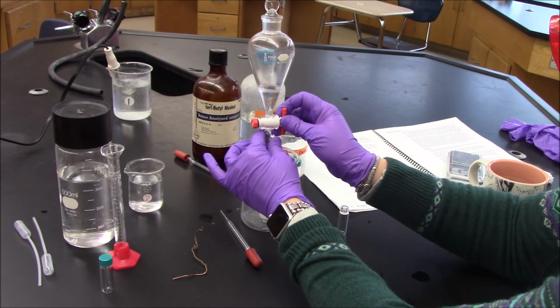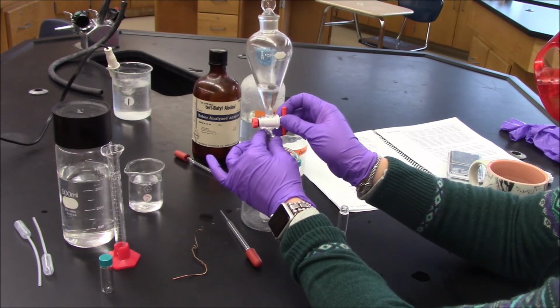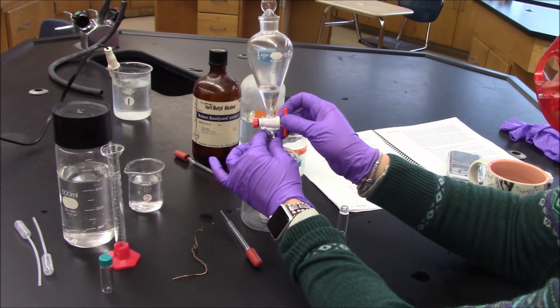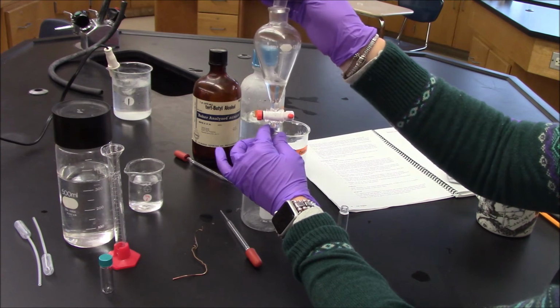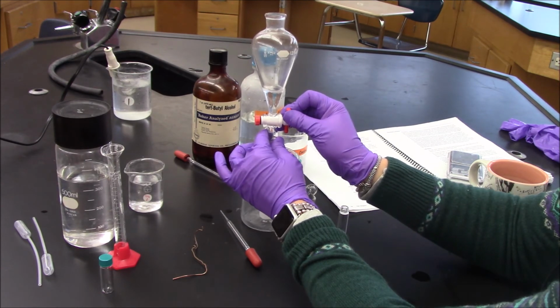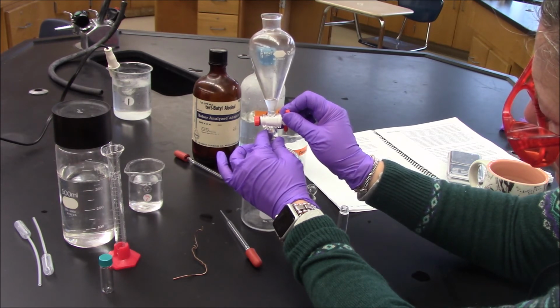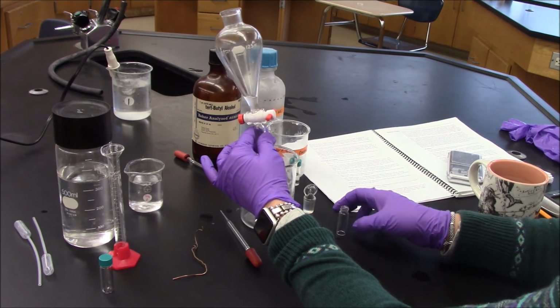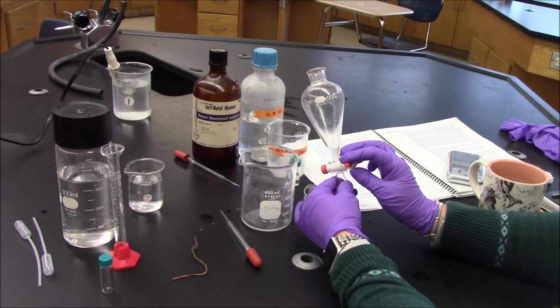This would drain. Don't know why it's not. I guess there's an air bubble maybe. It's going, it's just slow. This is very frustrating. Okay. Good point. I should take the stopper off, it's probably so tight it doesn't drain. There we go. Thank you, Mr. Gottlieb. Hold on, go slow, slow, slow, slow. Perfect. Okay. I'll take what remains. Uh-oh, this is going to be a challenge. What do we think? Do you think I can do it? I think I can.